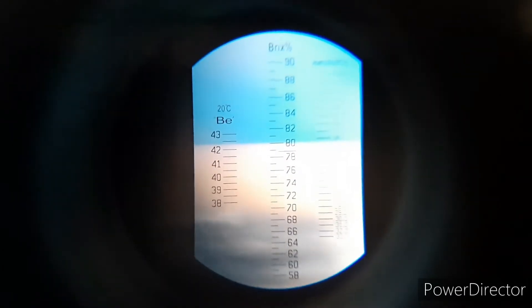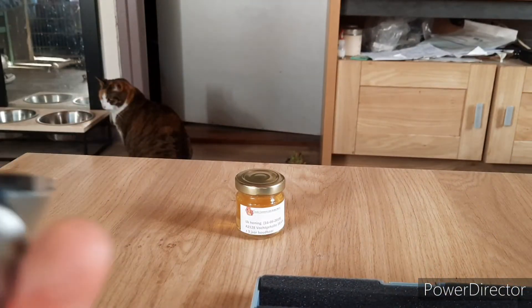So let's take the honey, let's test some honey. Well I took a bit of the freshly extracted honey. Now let's see what the result is.